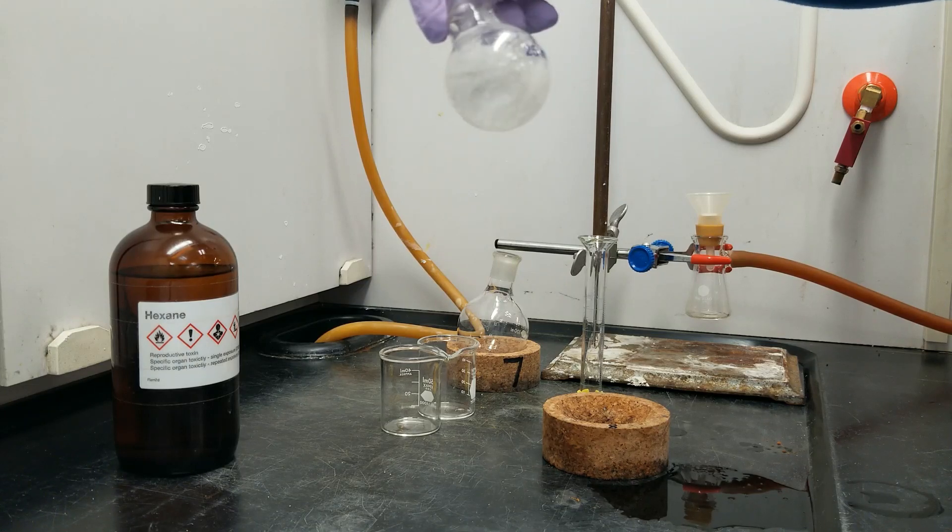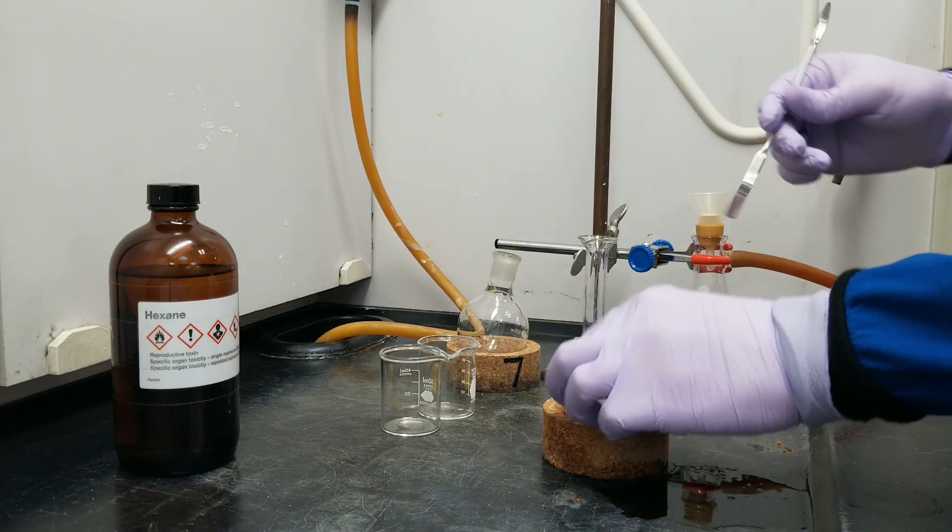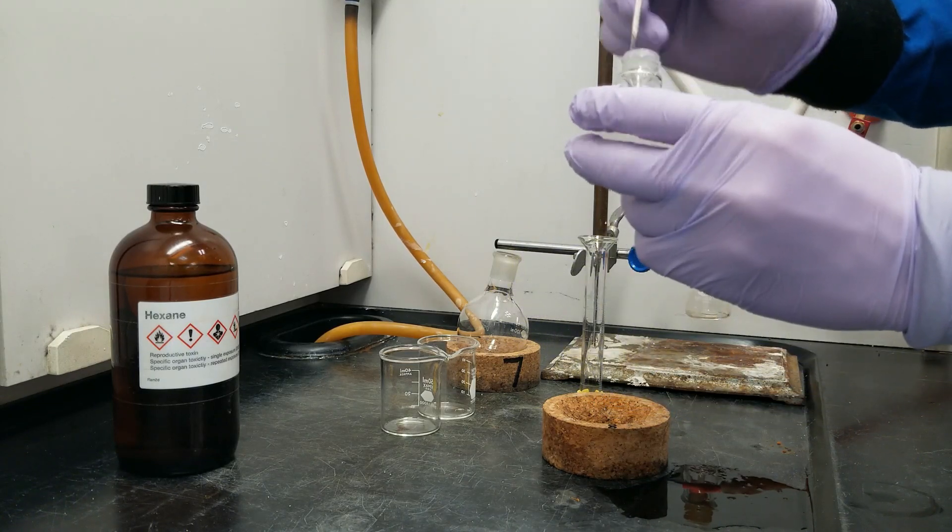Alright, so this stuff is way stuck on the sides of my container. I'm going to use a spatula to try to free it up a little bit more.